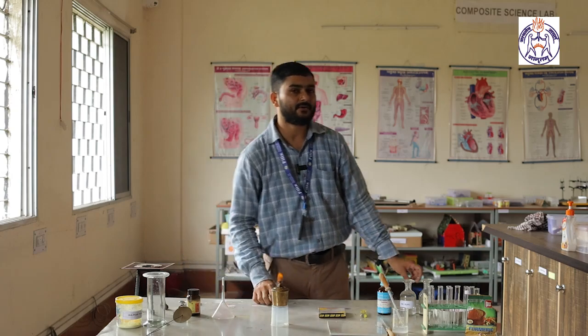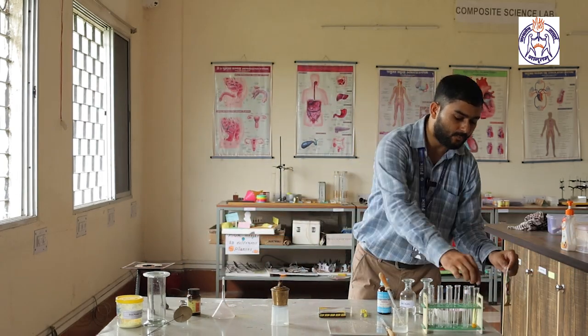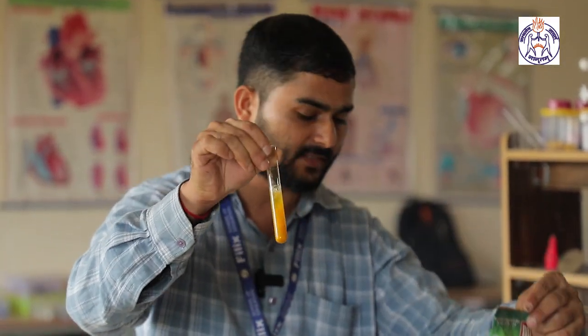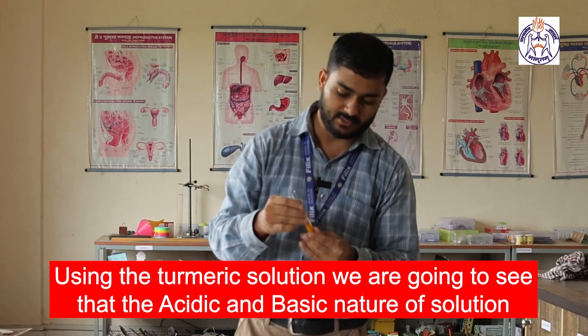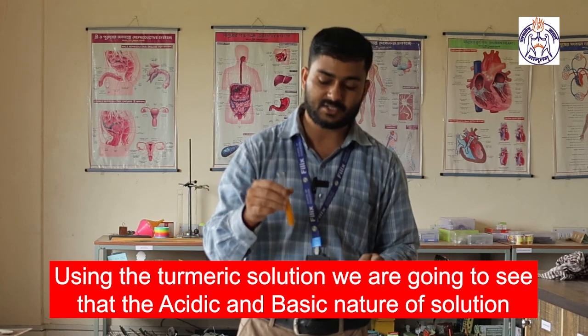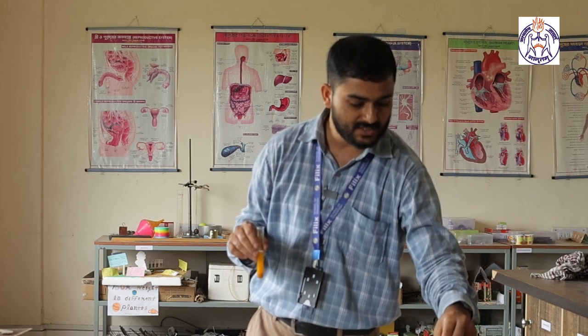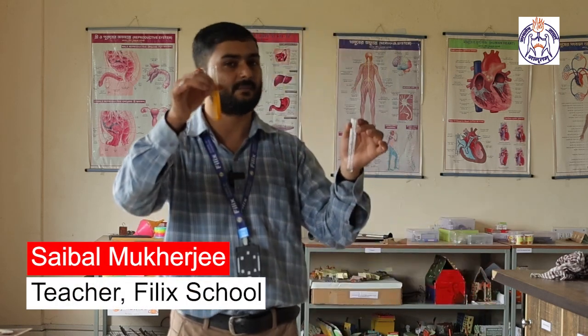My next experiment is for indicators. Now I have made one natural indicator using turmeric powder. So it is nothing but a turmeric solution. Using the turmeric solution, we are going to see the acidic and basic nature of any substance. So in presence of acid, what is the change in color, and in presence of base, what is the change in color of the turmeric solution.